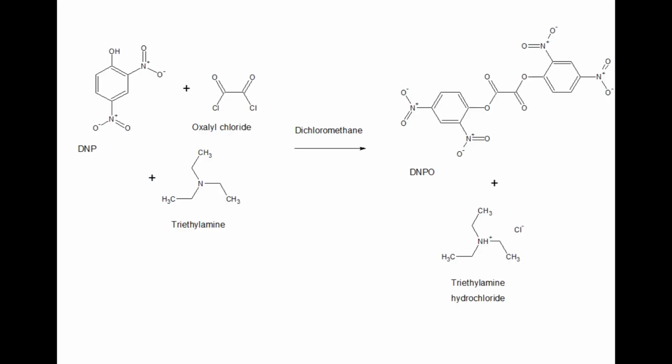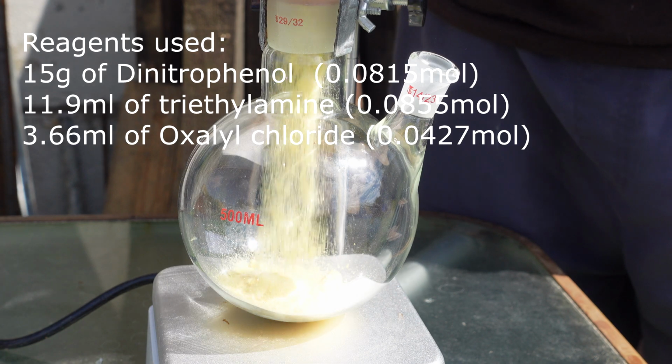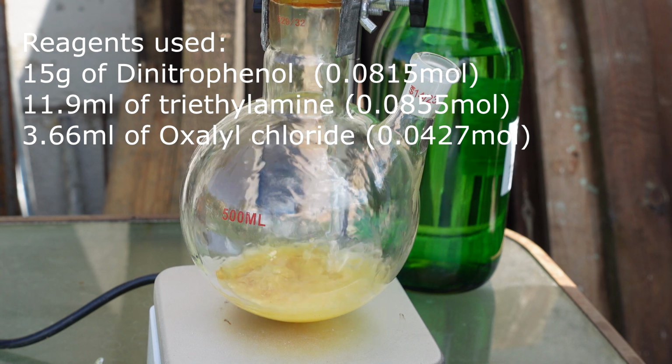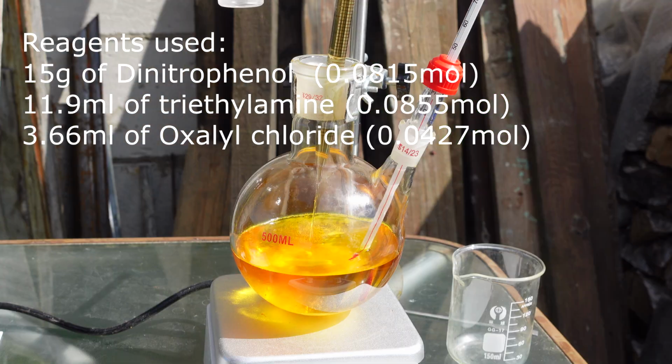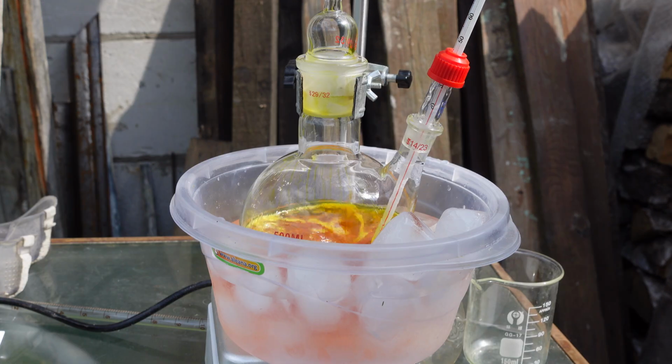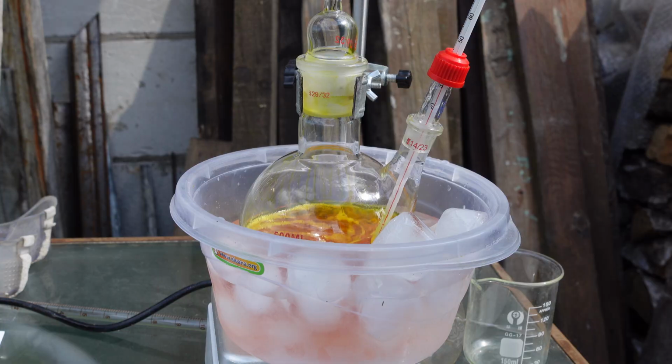The reaction itself is very simple. It's a standard acylation of dinitrophenol with oxalyl chloride, forming an oxalic acid ester, with the evolving hydrogen chloride being captured by triethylamine. I added dinitrophenol to a flask, dissolved it in dichloromethane, and then added triethylamine. I cooled it to 10 degrees C and started to add oxalyl chloride dropwise.